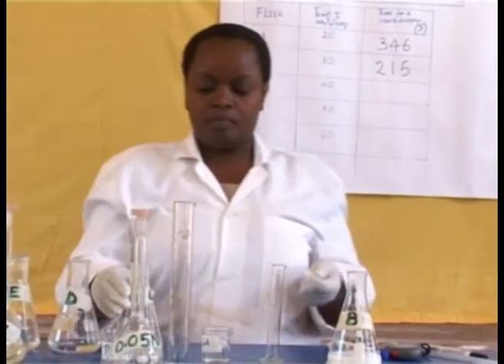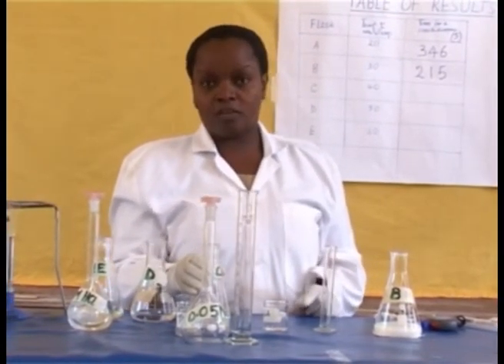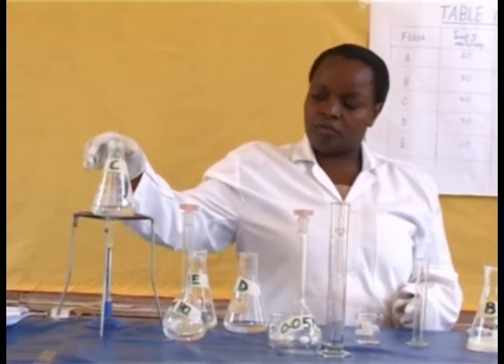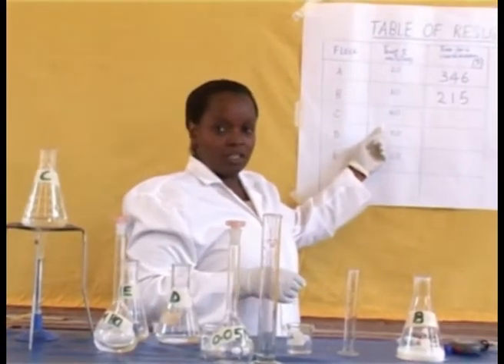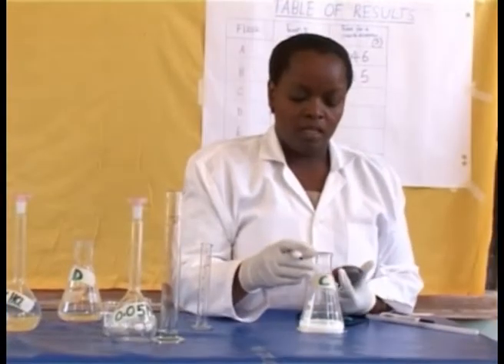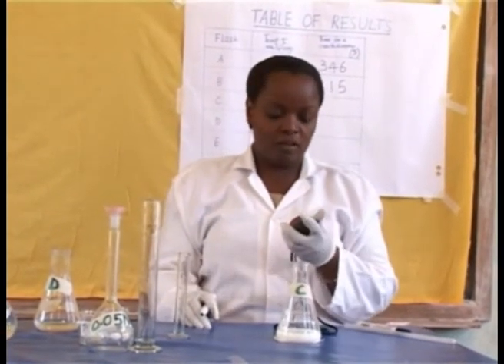For flask C, repeat the same procedure by warming the sodium thiosulfate in conical flask C to 40 degrees centigrade. The time taken for the cross to disappear in conical flask C is 67 seconds.